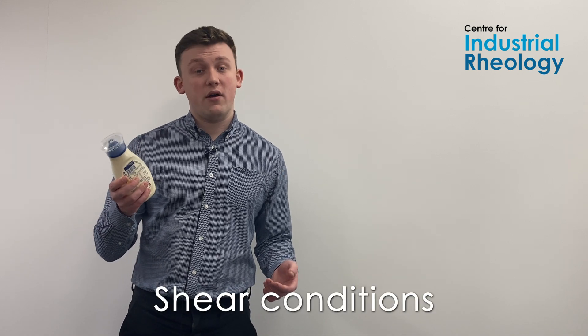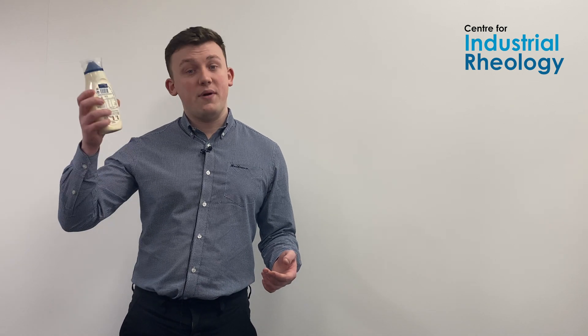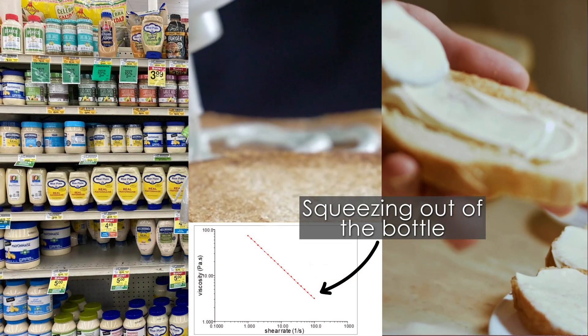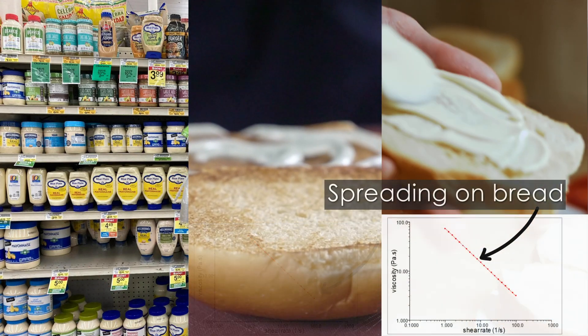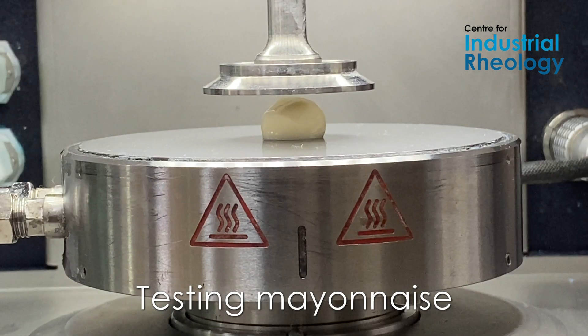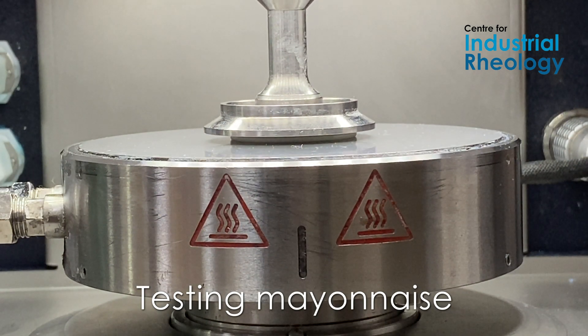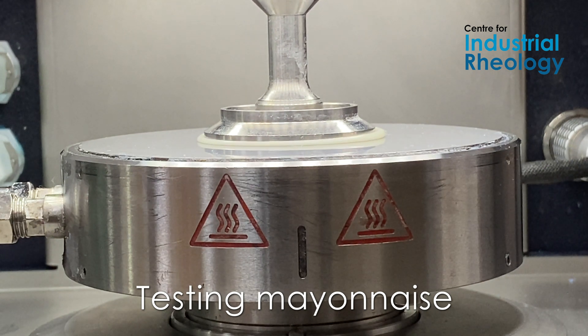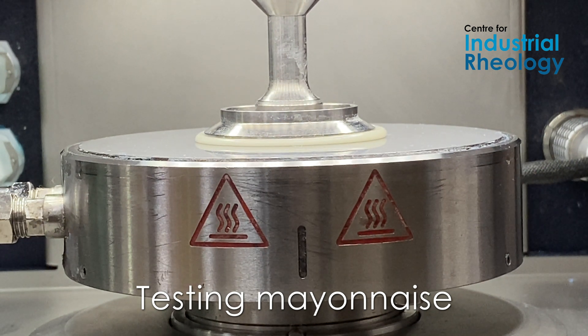For example, if we take this mayonnaise, there are different shear conditions being applied when the mayonnaise is just sat on a shelf, to when you're squeezing it out of the bottle, then when you're spreading it on bread. Measuring those different shear conditions across multiple points is really important to understand the full viscosity profile and how that material is behaving in those different conditions.